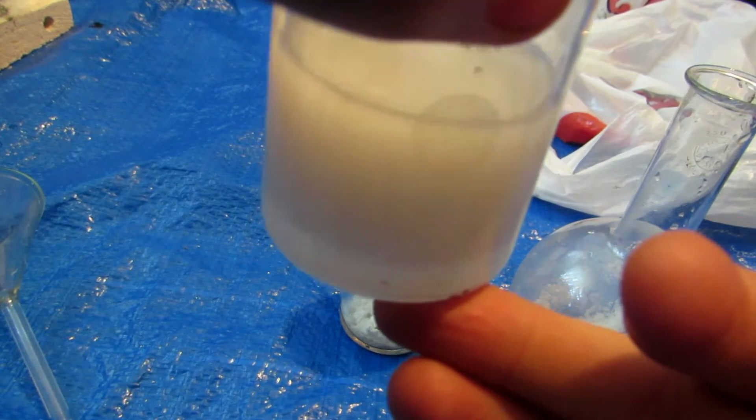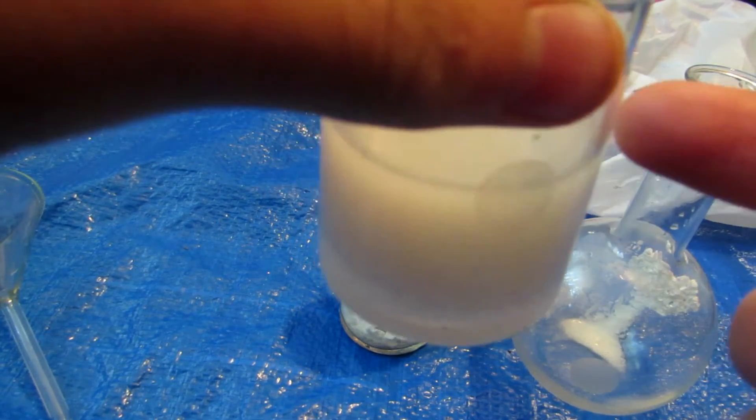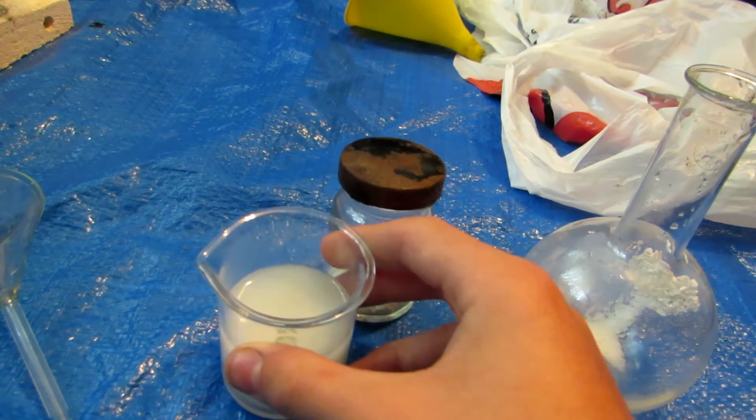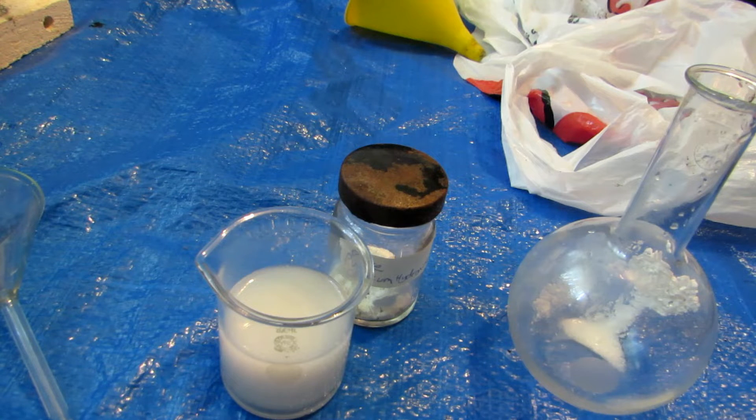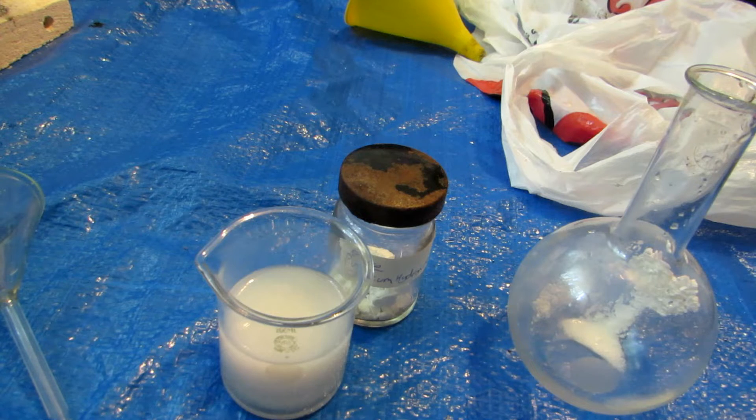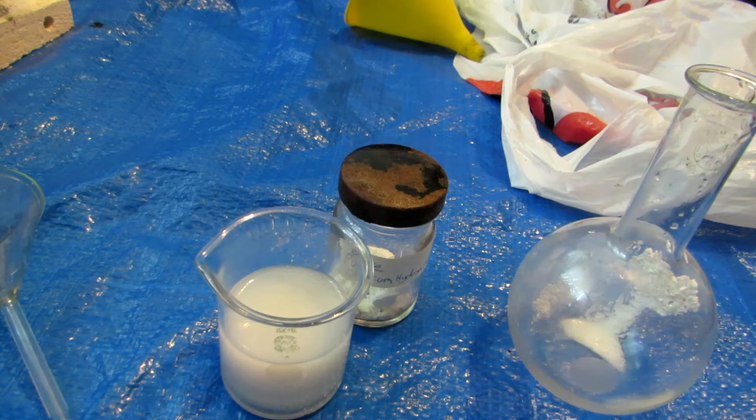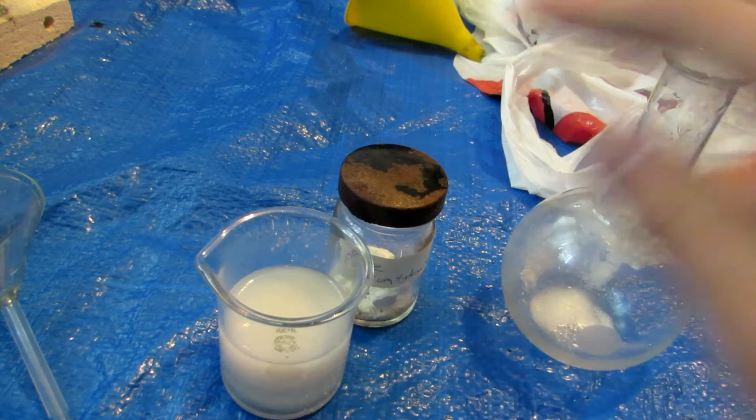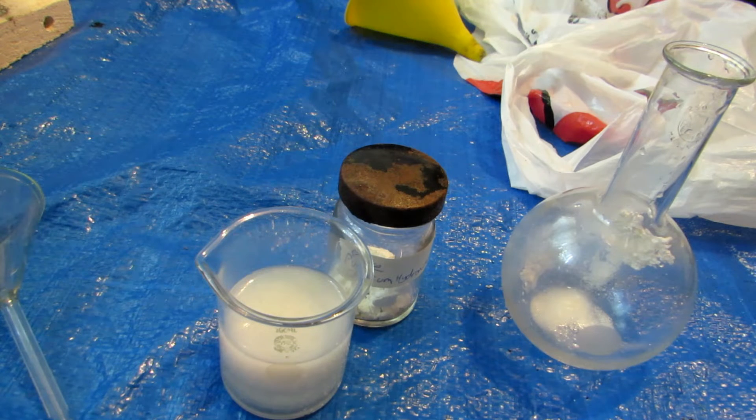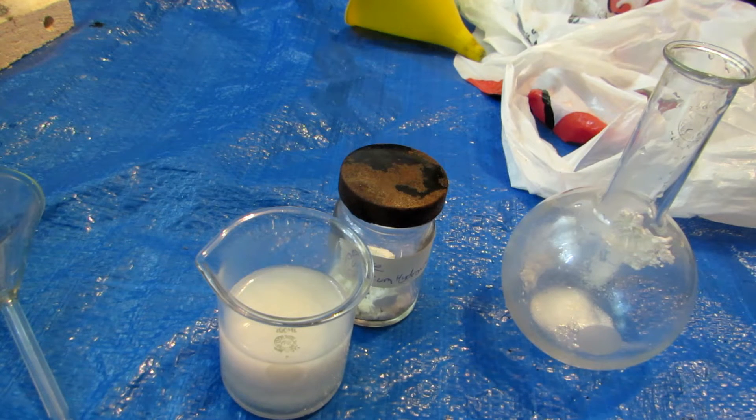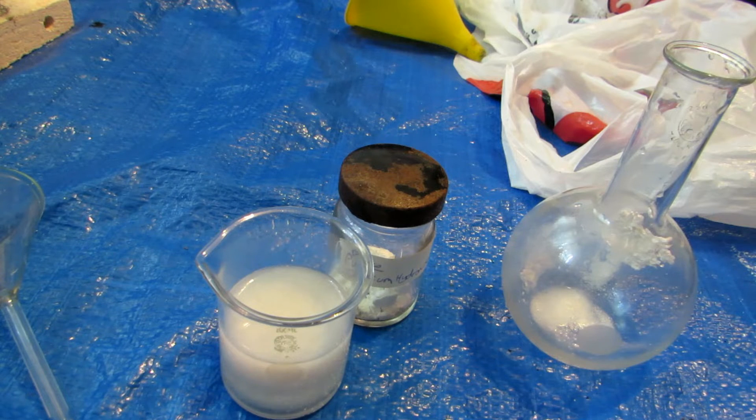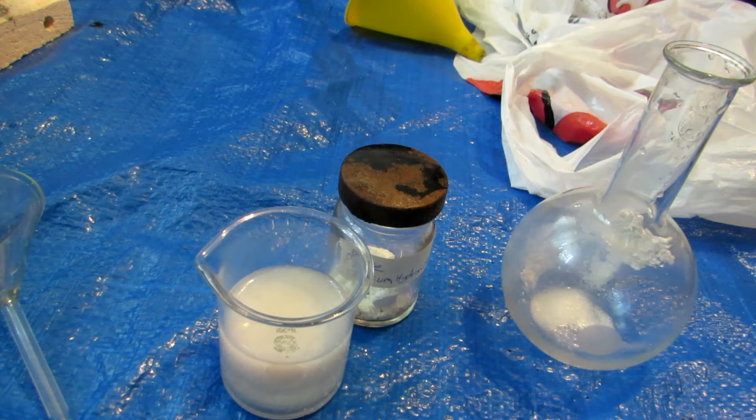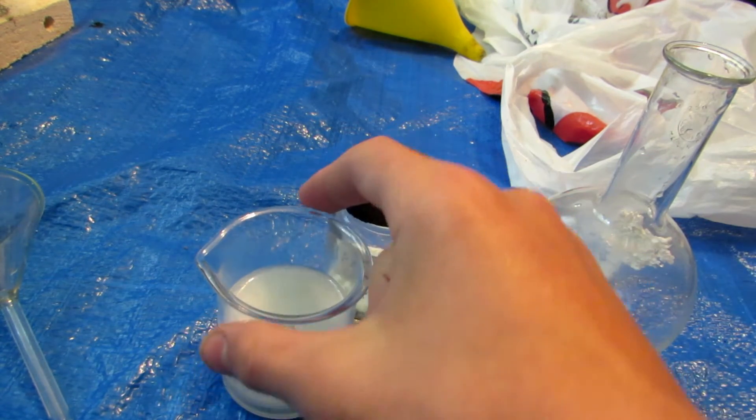Okay, so just after about five minutes, you can see we're forming a distinct layer on the bottom. And the fine particles of calcium carbonate seem to want to be floating at the top, although hopefully eventually it will sink. We should now have mainly potassium hydroxide in the solution and the calcium carbonate precipitating out. Now I'm very sure that not all the potassium carbonate reacted with the calcium hydroxide. All the calcium hydroxide's gone, but I'm sure there's still potassium carbonate in the solution. So after the full reaction occurs, we'll let this sit for a day or so. We'll filter it off and mix another solution of calcium hydroxide. Then we'll just put a bit of this solution into the calcium hydroxide solution, and if anything precipitates out, we know we still have potassium carbonate in this solution. So then we will repeat that to convert more of the carbonate to the hydroxide, and when we repeat the test and no more calcium carbonate precipitates out, then we will know that we converted all of our potassium carbonate to potassium hydroxide. Anyhow, so we'll meet you back tomorrow, or sometime then, when we have let this reaction sit for a fair amount of time.